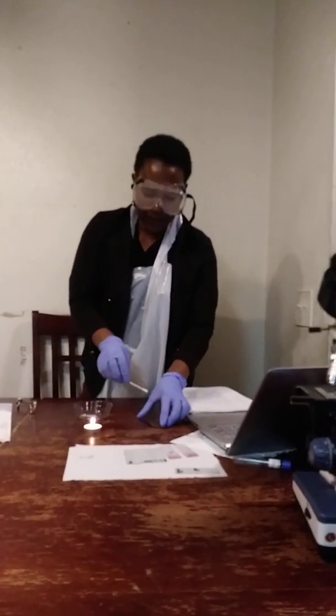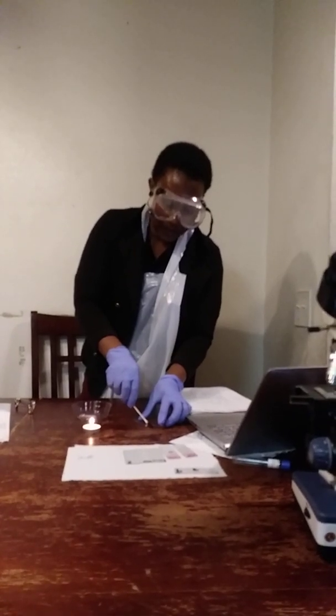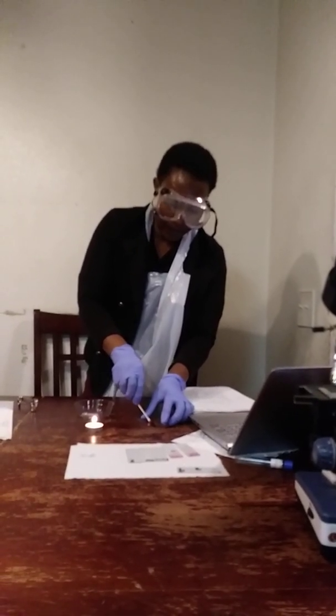And I will transfer this to the circle where the drop of Congo red is, and I will rub it there.